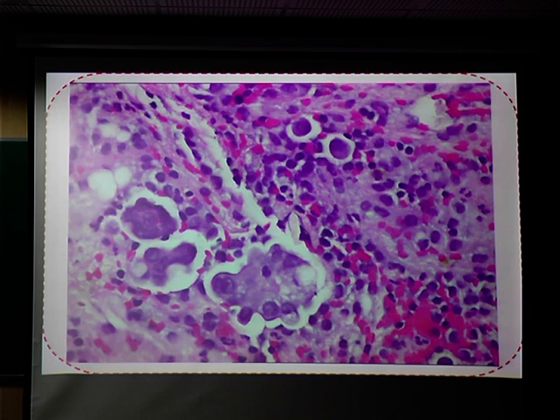So we went ahead with the preparation of cell blocks. This case was contributed by Dr. Bharat Rekhi from Tata Institute. And in the block also we could not resolve the dilemma whether it is an adenocarcinoma or a mesothelioma. So what do you do next?